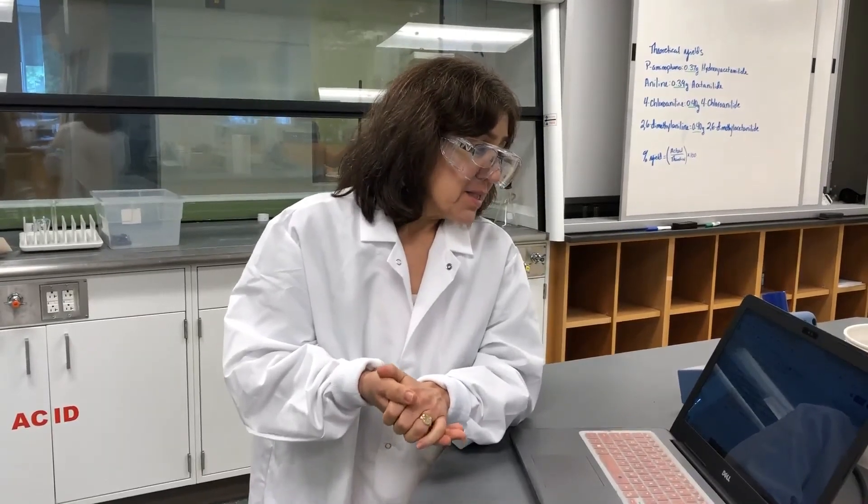You'll be using the Rotovap this lab, so please watch the Rotovap video, which describes how to use the Rotovap. You'll be using diethyl ether, which is a highly flammable solvent, so be aware of that. And again, always dispose of your waste properly.